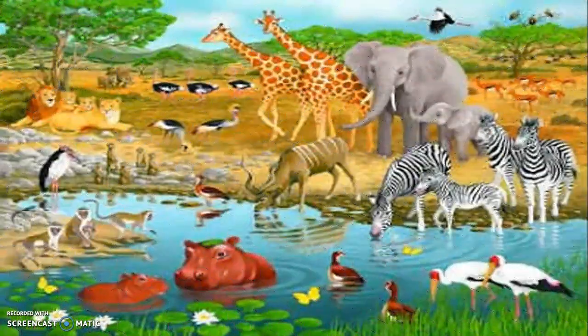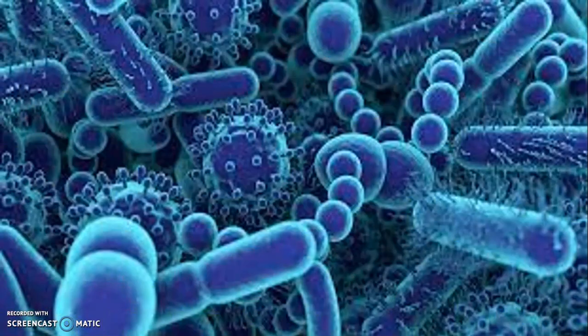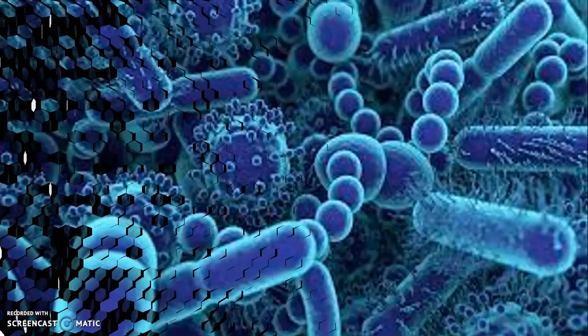You know that in our ecosystem, there are many living things around us. Some living things are quite big, while others are small. But did you know that there are living things which are even smaller, that we cannot see them using our naked eyes? Yes, that's right. And to see them and understand their characteristics, we need a special instrument like the microscope.